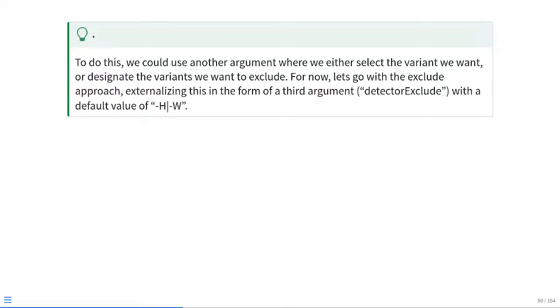So, once again, easiest way to do this will once again be a new argument, but also setting a default so that we don't need to actually worry about it on our everyday basis. So we're going to go ahead and call that third argument detector exclude, and in this case, since we want to just keep those hyphen A column names, we're just going to have the default value be hyphen H and hyphen W to handle any of those edge cases as they may be encountered.